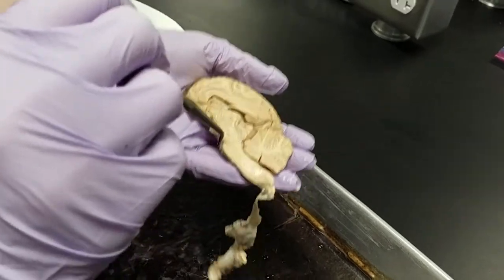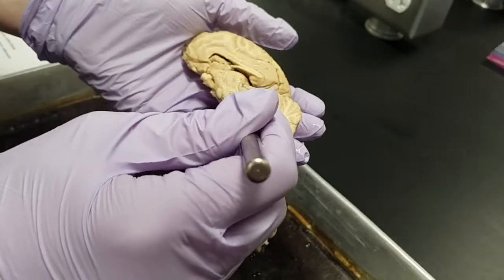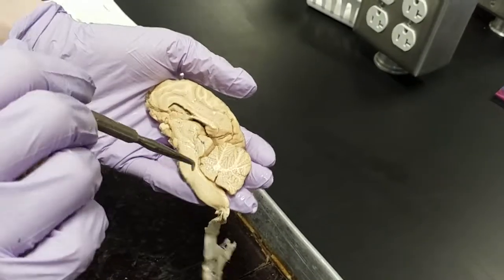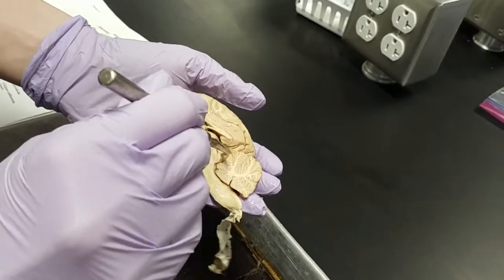And so, wait, where'd you say the pons was? So it's always right below the cerebellum. So then the midbrain should be up here. Okay. The midbrain is made of the tectum, which is composed of the superior and inferior colliculi. Okay. And it's also the tegmentum, which is the circular part. So this whole square is the midbrain.